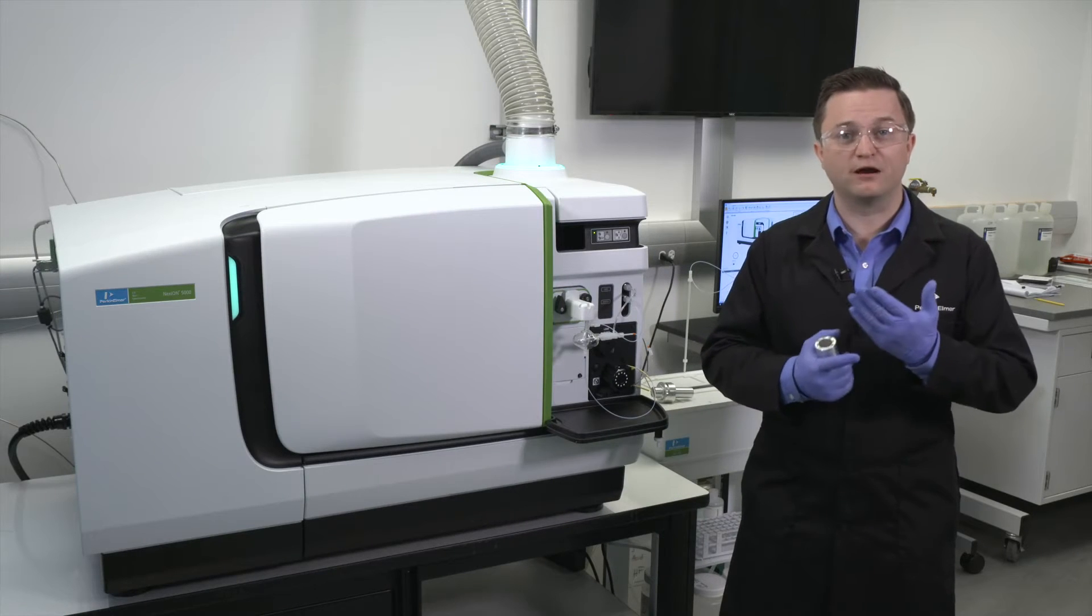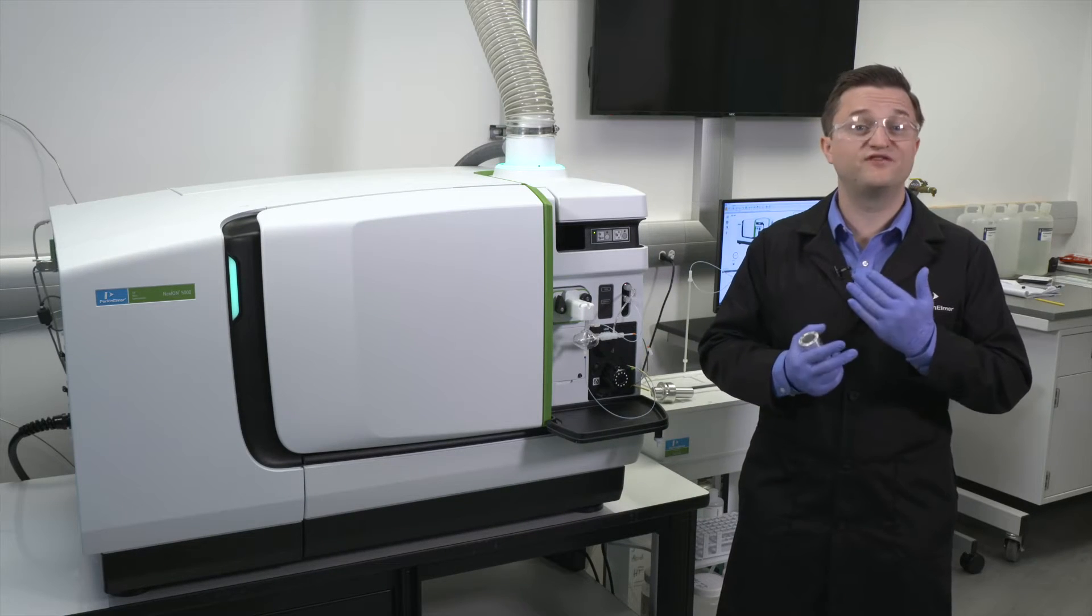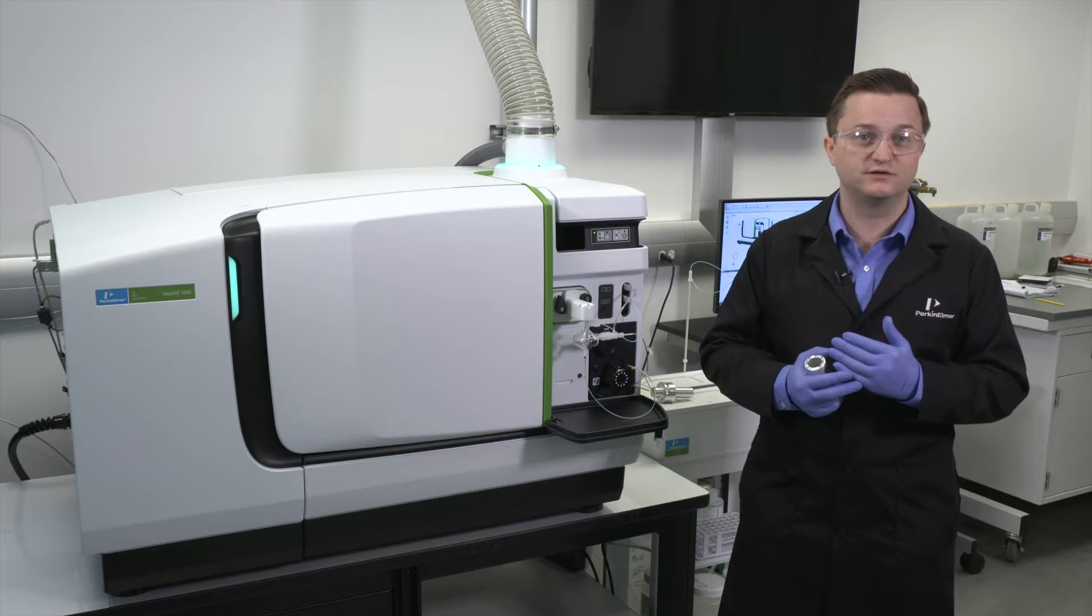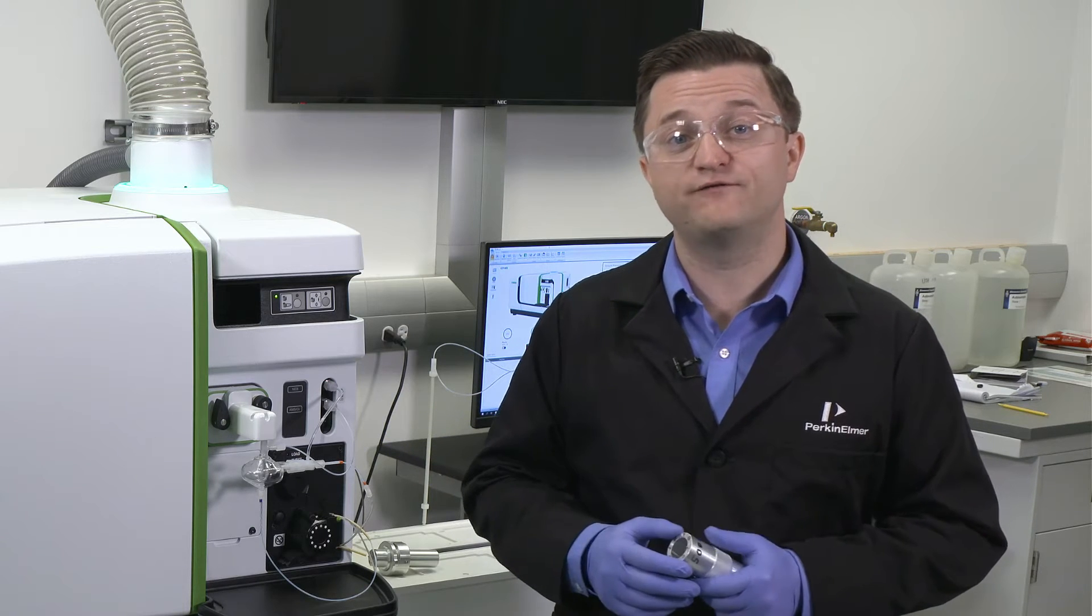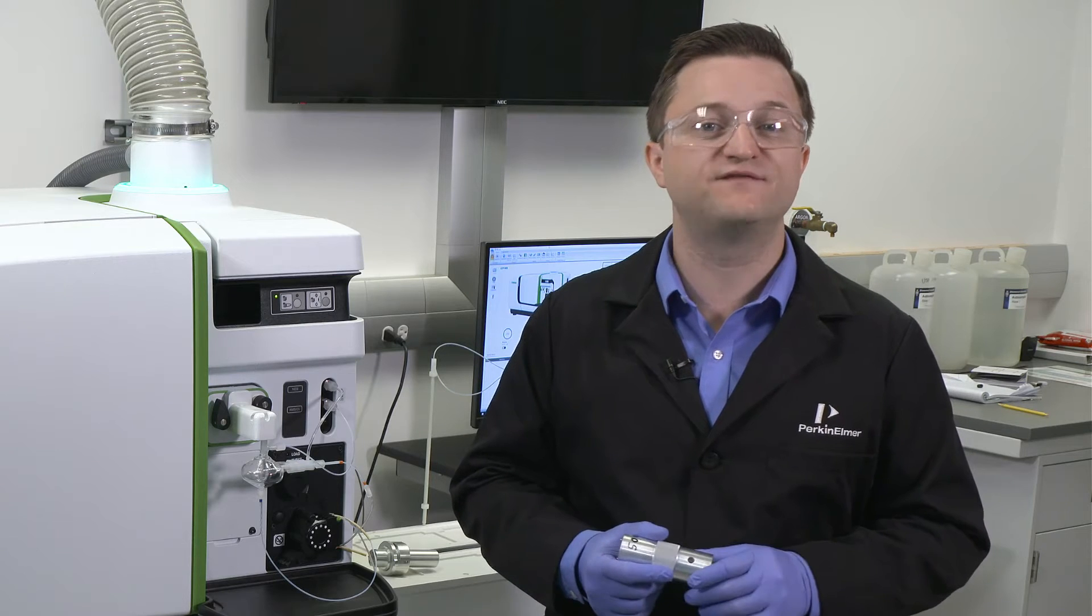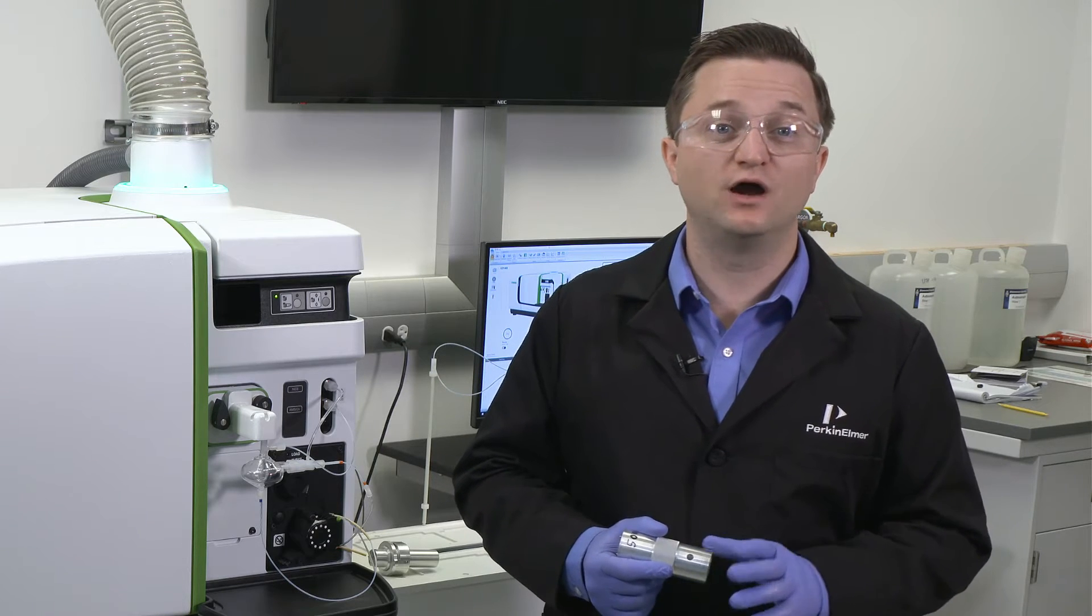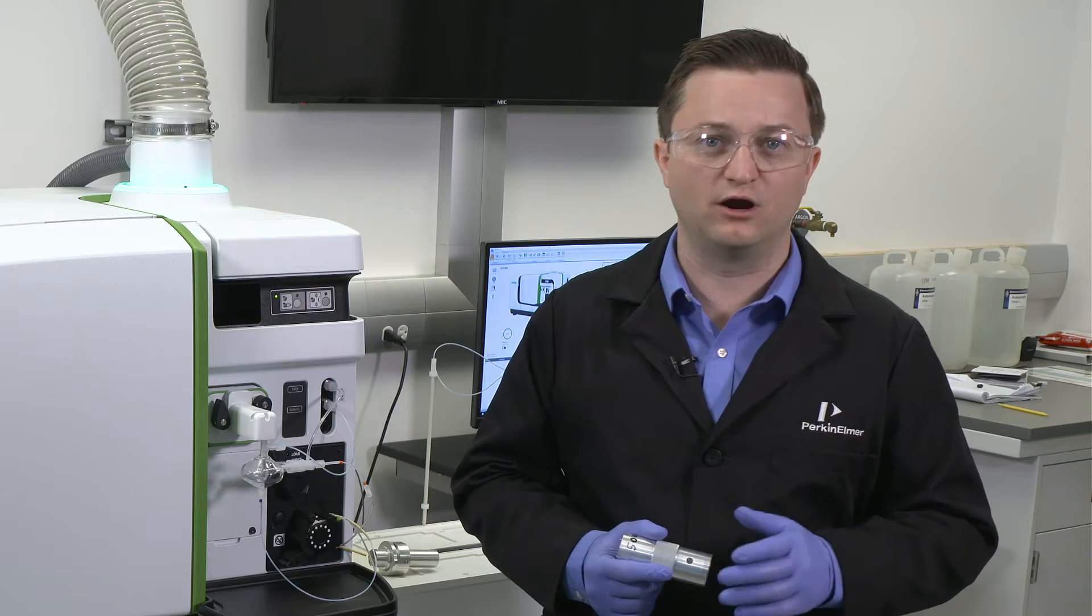Before starting, put on a pair of powder free gloves to prevent contamination of the cones. If the plasma is lit, turn it off and allow for the instrument to cool for at least 5 minutes. Do not attempt to remove the cones while they are hot.